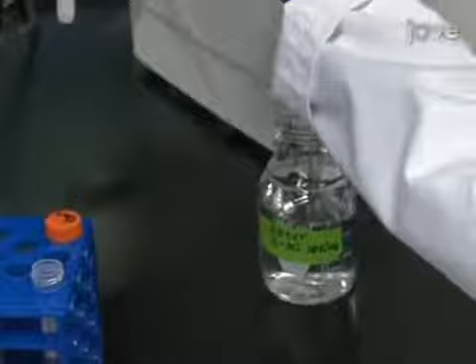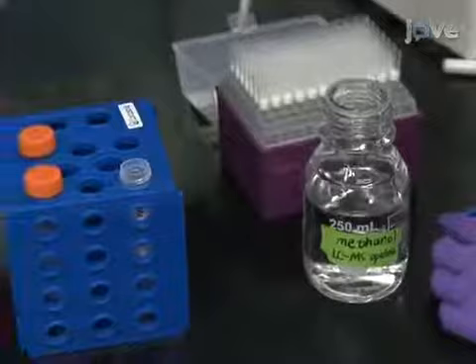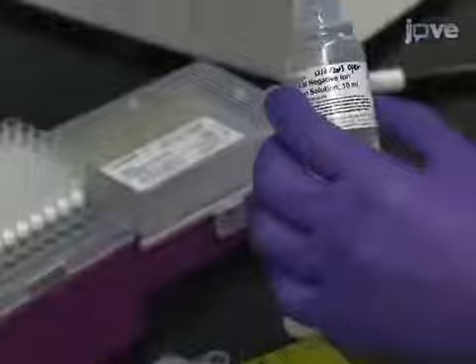Following this, dissolve 5 mg of both sodium fluoroacetate and homovanillic acid in 5 milliliters of water to make a final concentration of 1 mg per milliliter. Then, dissolve diazinon in methanol to make a final concentration of 10 mcg per milliliter. To prepare 1 milliliter of negative low mass calibration solution, mix 960 microliters of the thermo negative calibration solution.